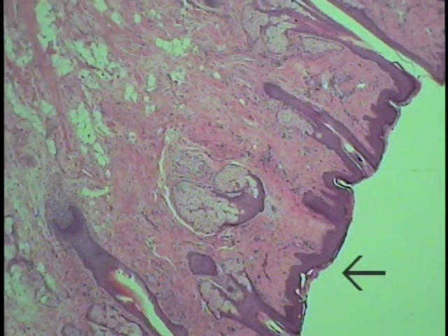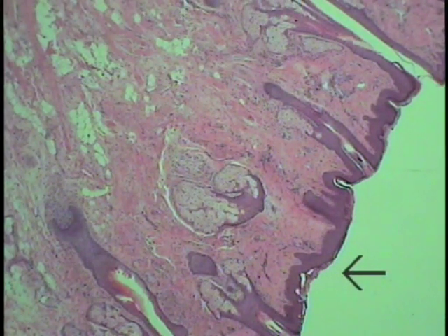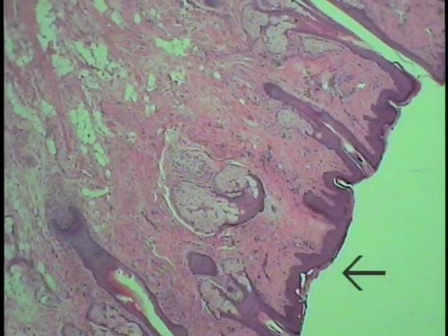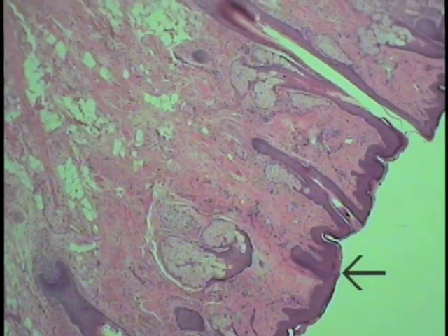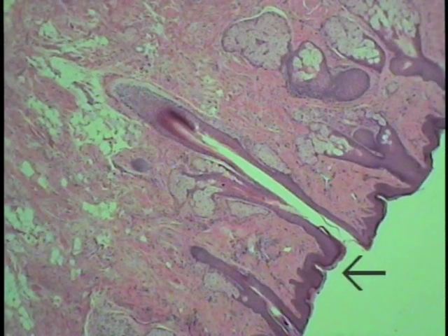This field shows a portion of the human lip. When considering the tubular digestive system and the oral cavity, it's best to consider the organization in strata or layers. Structures in the lip correspond to other regions found in the oral cavity boundaries. The lowest power scanning objective shows the outer surface of the lip, lined by typical thin skin with a keratinized stratified squamous epithelium.